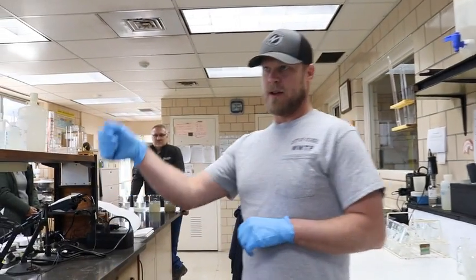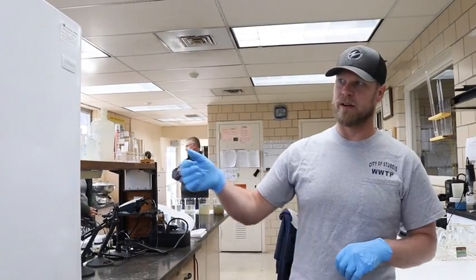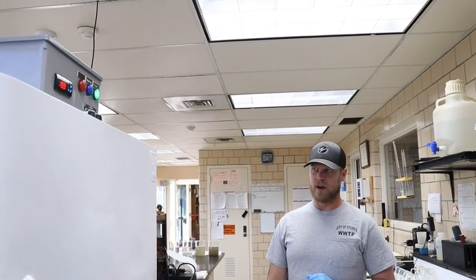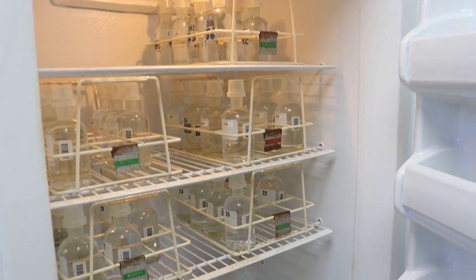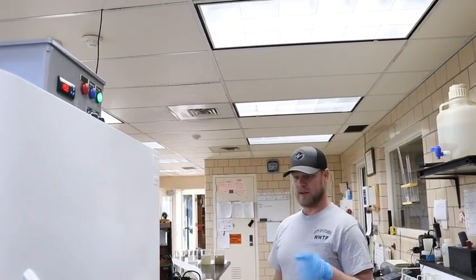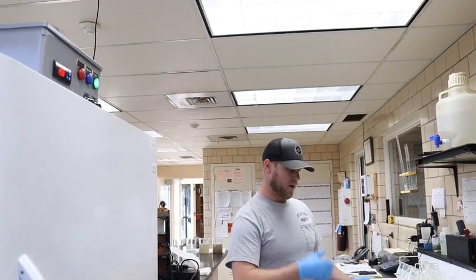This here is our BOD incubator, our Biochemical Oxygen Demand incubator. This is another test that we have to run daily. This test requires 5 days of incubation. Dark. There's no light in there. You cannot have any outside influence on these bottles that go in. So once you run the test, you measure them out, you add your chemicals and everything that you need, you incubate it for 5 days, then we bring them back out.